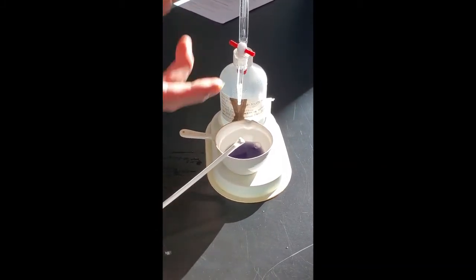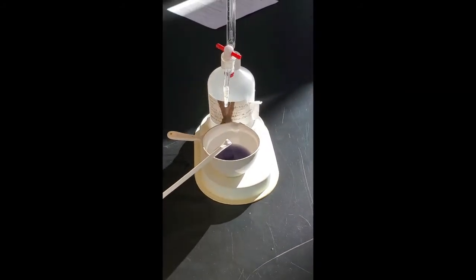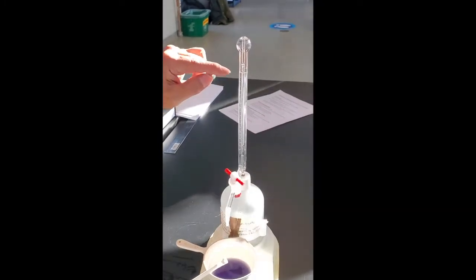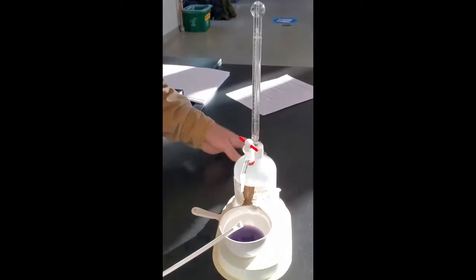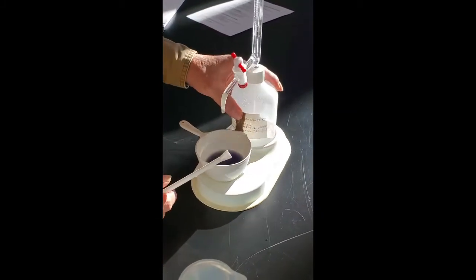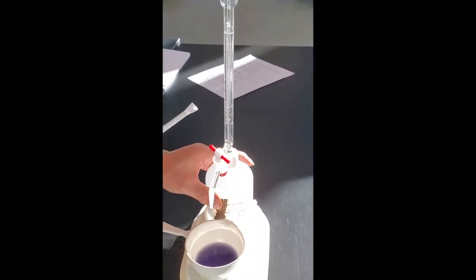Now I'll do the reading. Right now it is... it's probably one mL. It's somewhere around one mL. Let's turn a little bit... oh no, it was 0.5, only 0.5 mL.